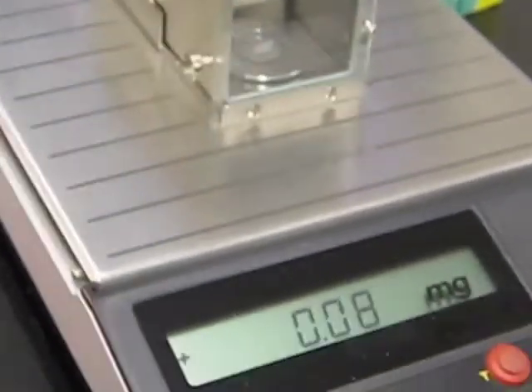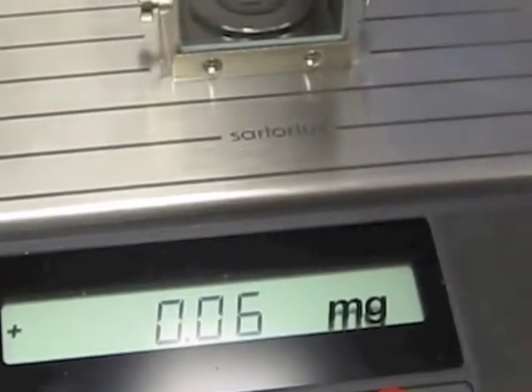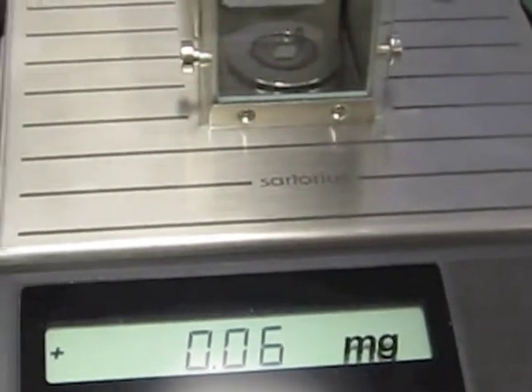Again, this is that piece of weigh paper that was on the scale. That's important. Make sure that you're using the right one there. Transfer that back over to the scale, and then it's straightforward. You just read the weight off the front of the scale here. It's going to be in milligrams.